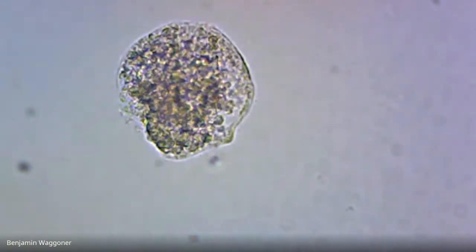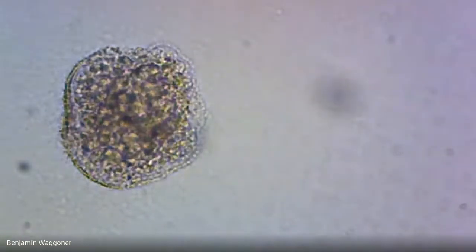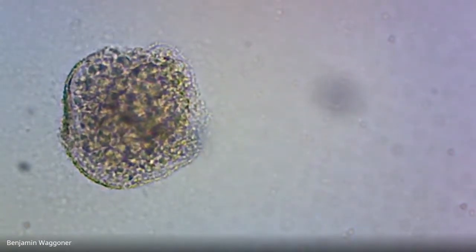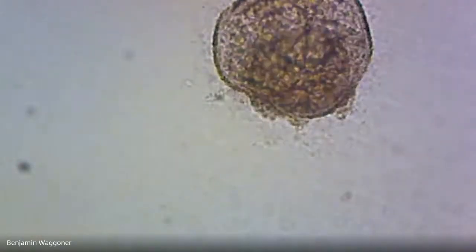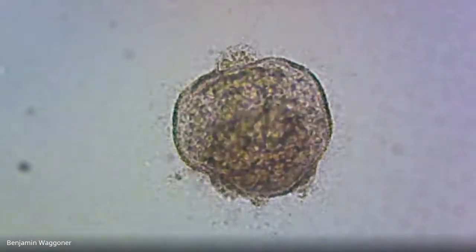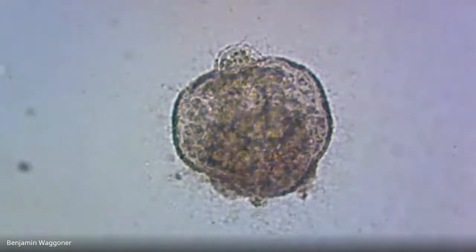That one's just plain screwed up, as is that one, and as is that one, although that one is just being swarmed.